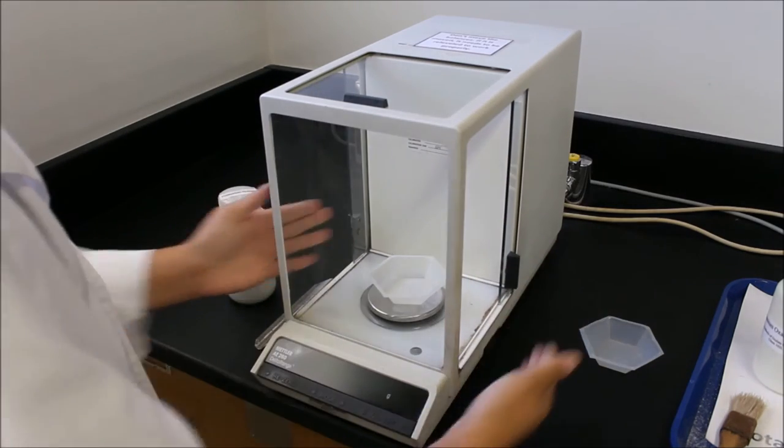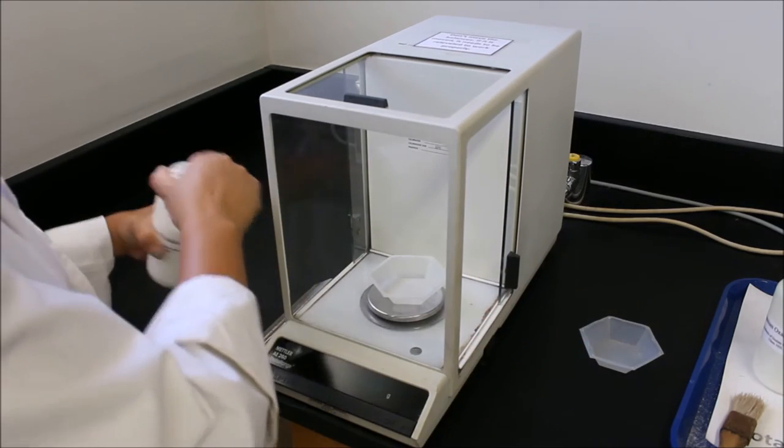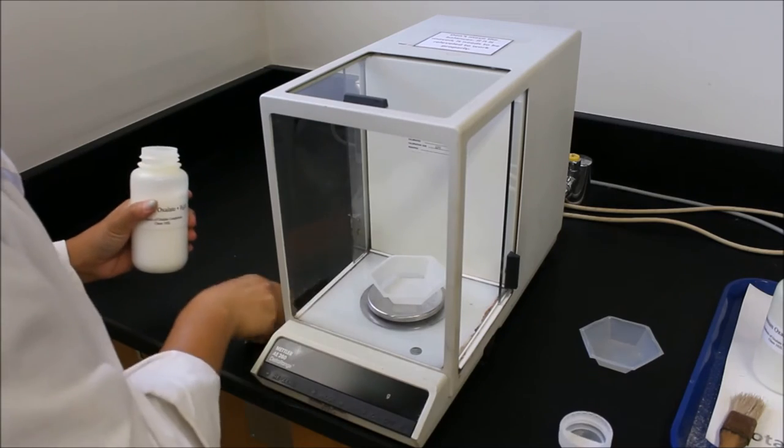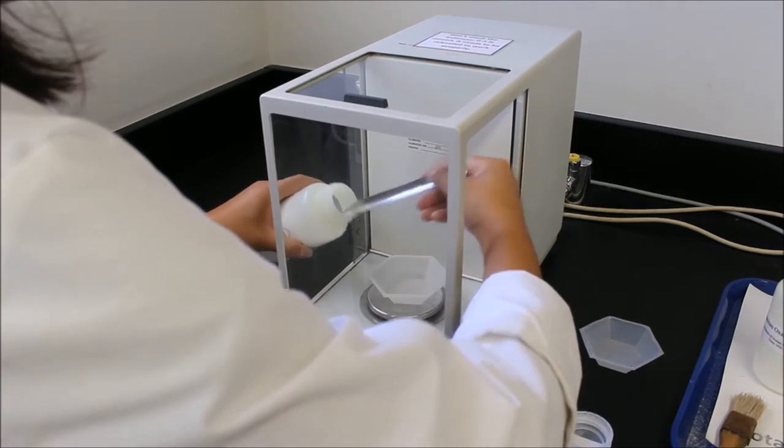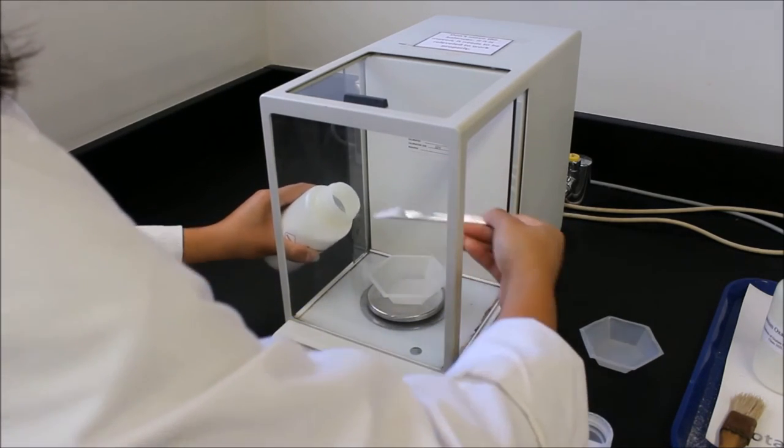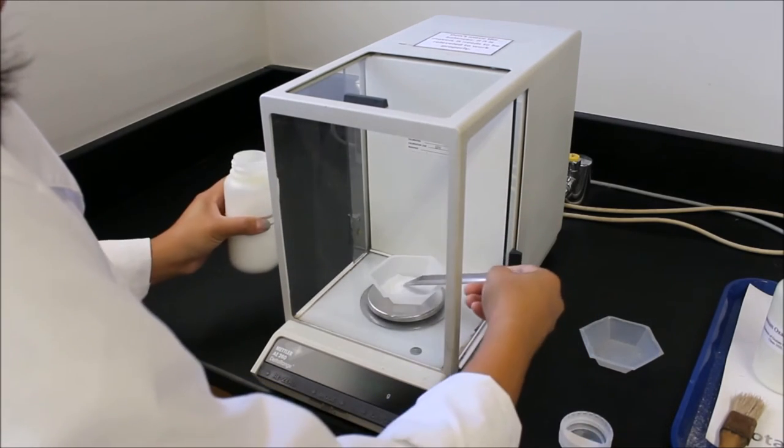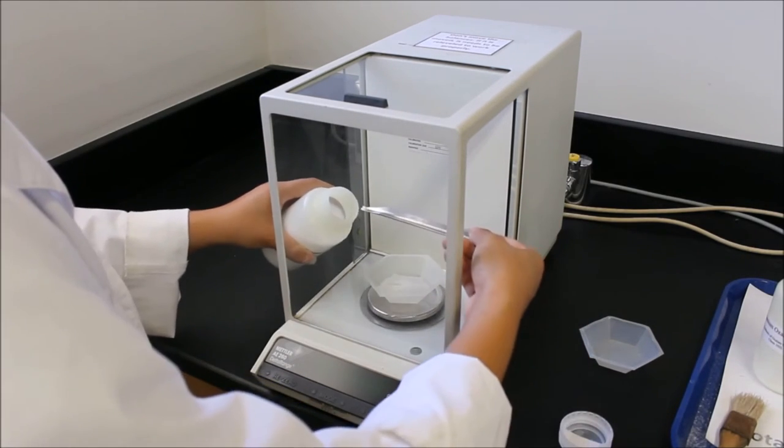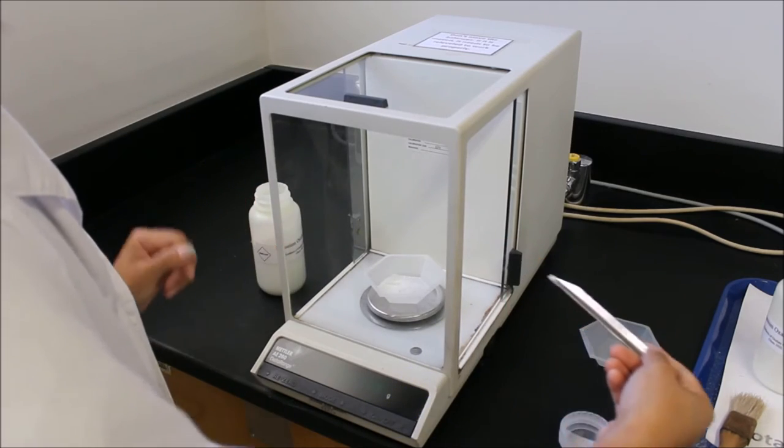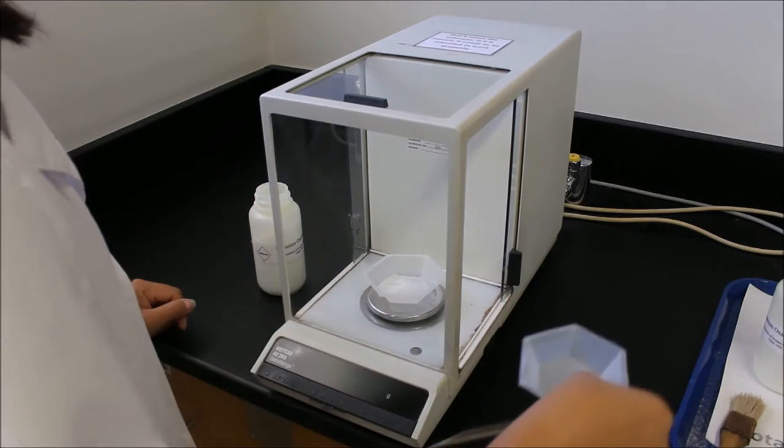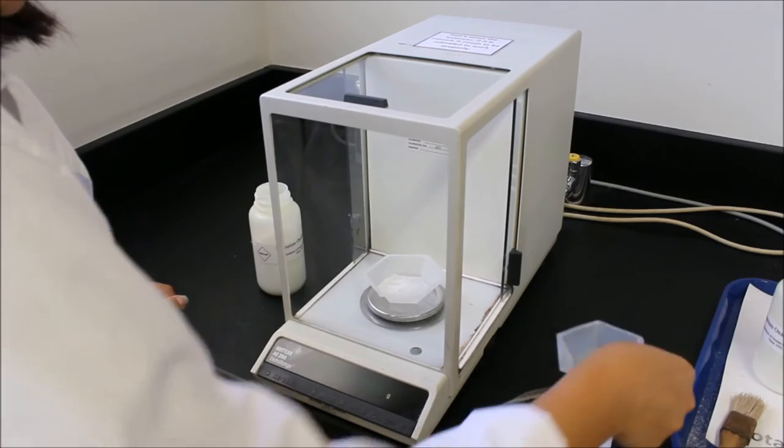You're going to weigh out however much of whatever compound that you need and you'll be all ready to go. Remember, if you take too much compound, you can't put it back into the bottle. We'll put it into a waste dish next to it.